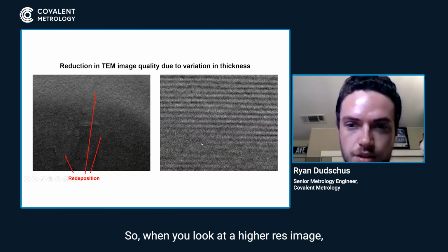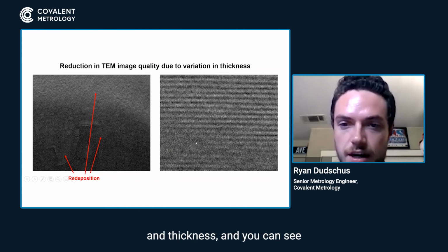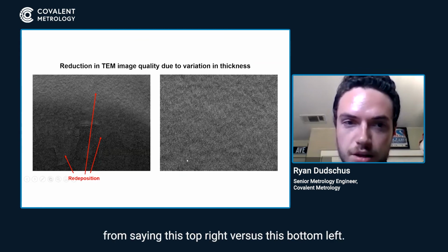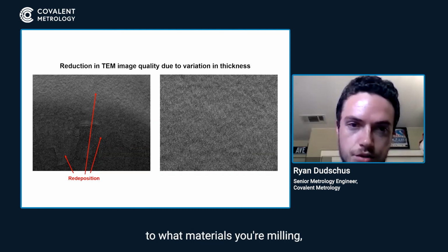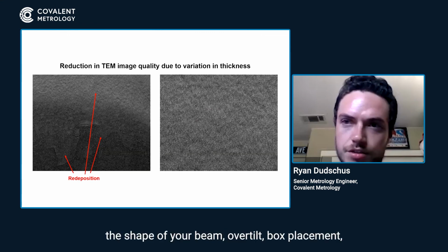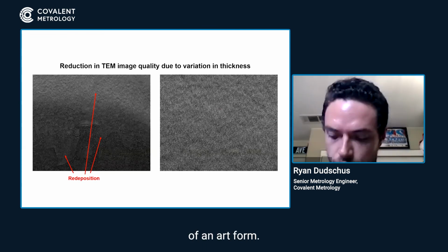And when you look at a higher res image, you can see a lot of variation in grayscale and thickness. And you can see how the resolution changes from, say, this top right versus this bottom left. So this is something you really have to keep in mind, which is why you need to pay attention to what materials you're milling, the shape of your beam, over tilt, and box placement. And this is how it starts taking form of an art form.